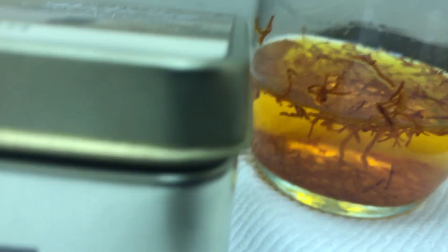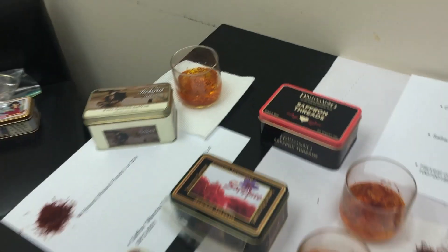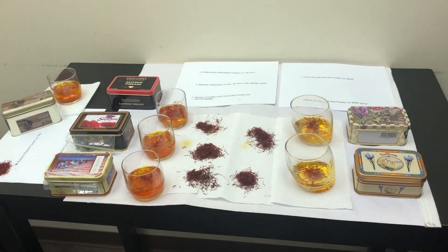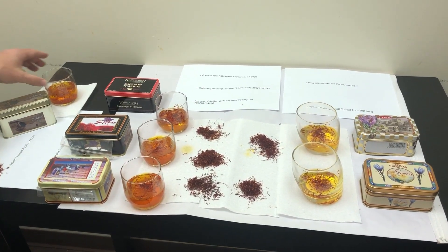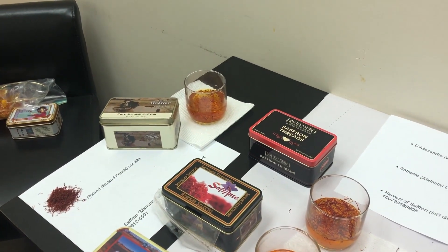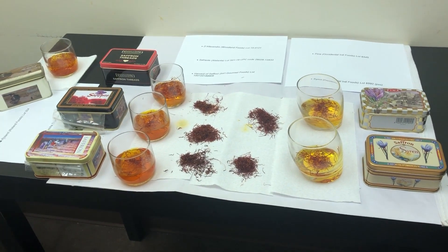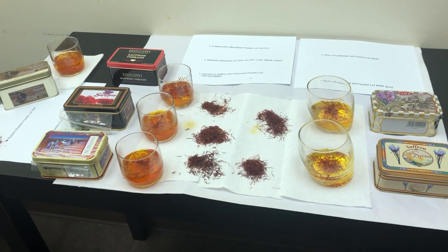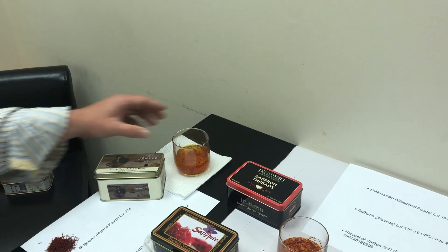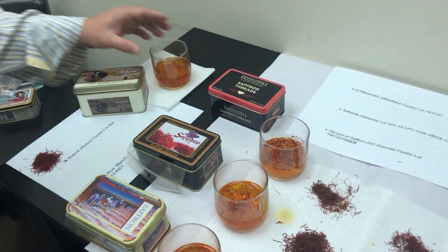That's lot 324 from Roland Foods. Getting one last look at all six samples together — even though it's only been a few minutes after immersion, we can already see the effect on the color. It's already done something that even a less-adulterated saffron might not show for 8 to 10 minutes. In this case, it was evident after just two and a half minutes of immersion, which is a very bad thing.